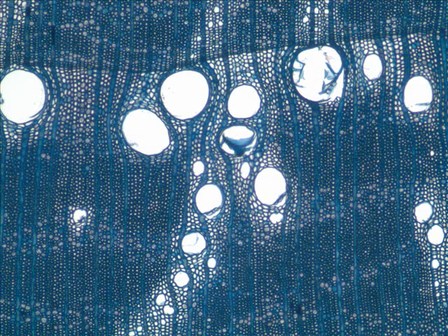Again, as we look at this cross-section, the big ones right off, we can say those are vessels, but we need to look closer at some of these others. Here we are up close and personal, and we have these across here, that's one kind, and then we have these here, which is another kind. Which are these right here and right here? Those are fibers, cut across. They're open in the middle, but it's open now because it got cut across; normally that opening doesn't open to the outside world.